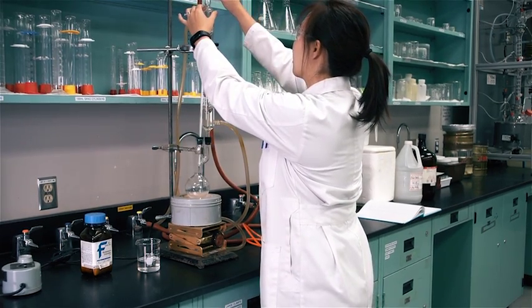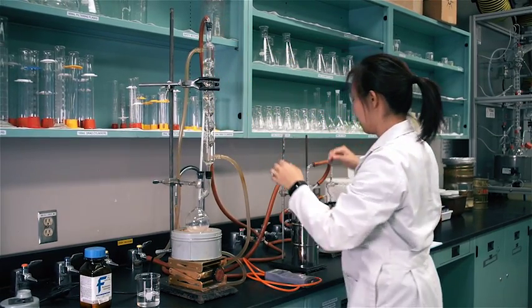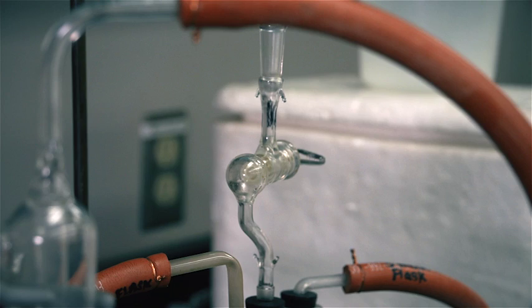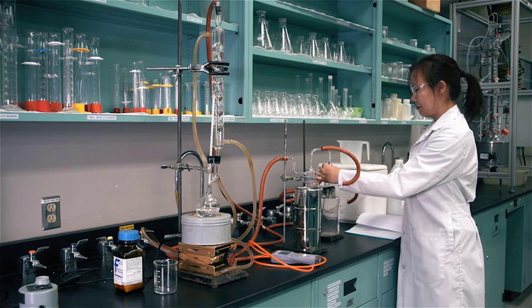Check the apparatus to make sure all stoppers are firmly in place. Two stopcocks allow air and vapor to go in and out of the system.